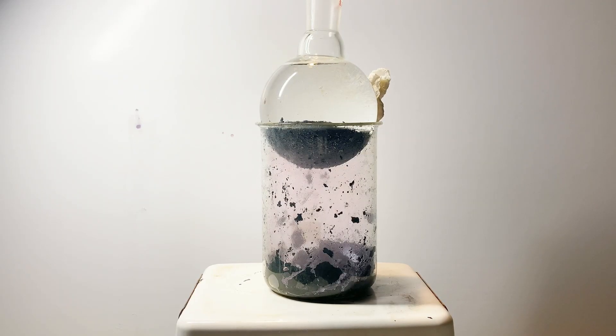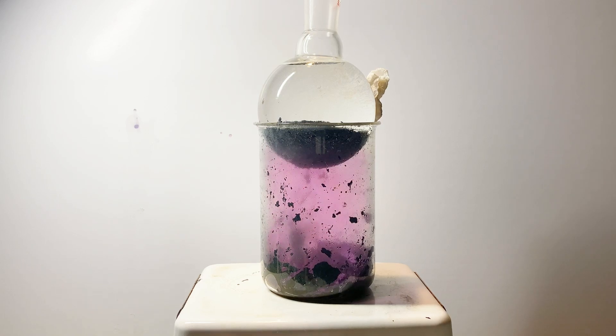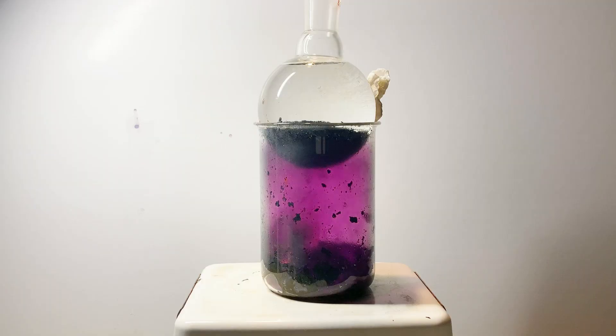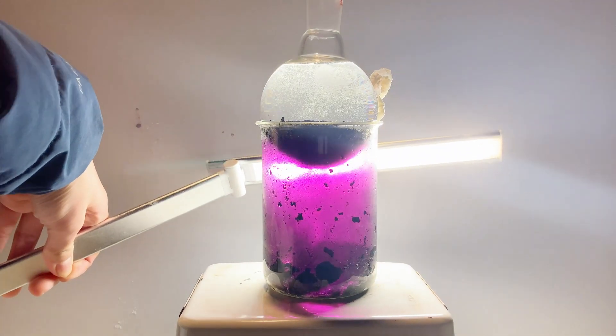The recrystallization involves a temperature gradient, from hot to cool. Again, on the top I have a recrystallizing flask, and by sublimating the iodine then recondensing it on the cool surface, it increases its purity. Now after turning it up on max heat, nothing much seemed to happen, but gradually after a few minutes, the beaker started filling up with a bunch of saturated violet iodine vapor. I've seen iodine in textbooks, but it's truly a whole other deal to actually see it in real life — the vapor is so unbelievably purple it feels fake.